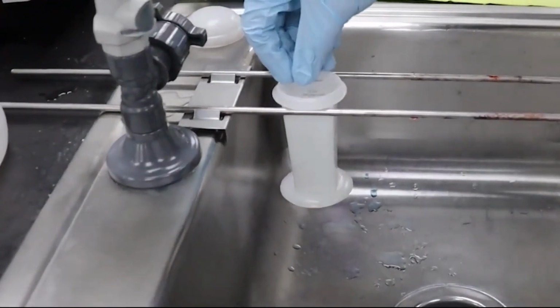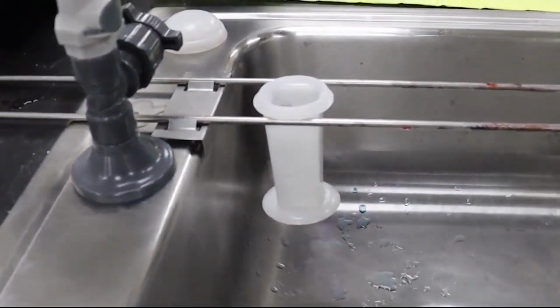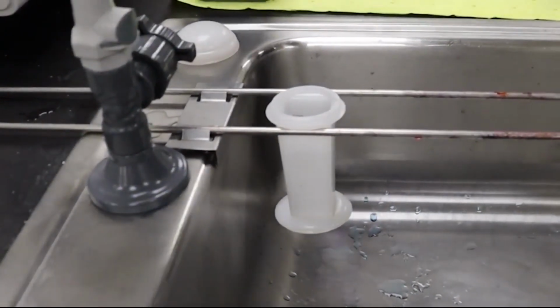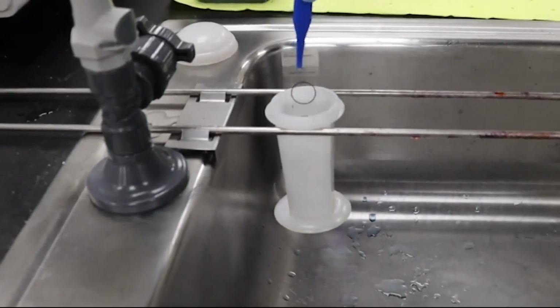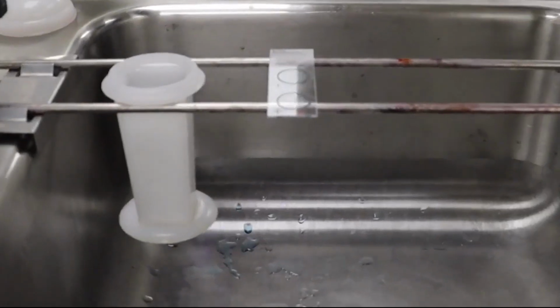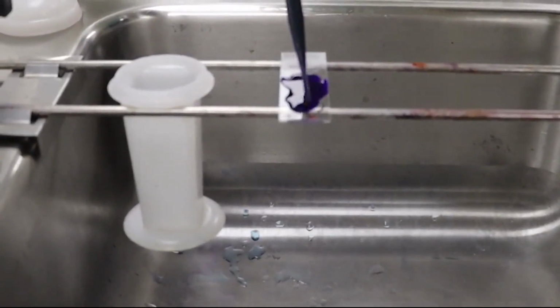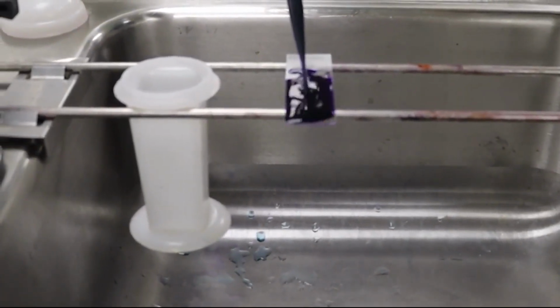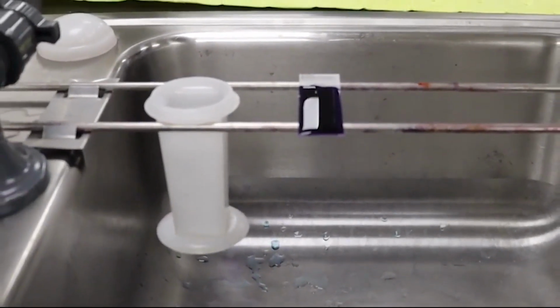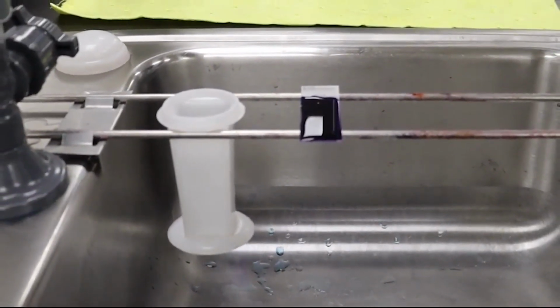Now we are going to take a look at an example manual gram staining procedure. We start again by fixing the slide in methanol and also allowing the slide to completely air dry afterwards. We are then going to apply our crystal violet solution to the slide for 30 to 45 seconds. It's important to apply enough liquid to the slide to completely cover the sample and prevent drying.